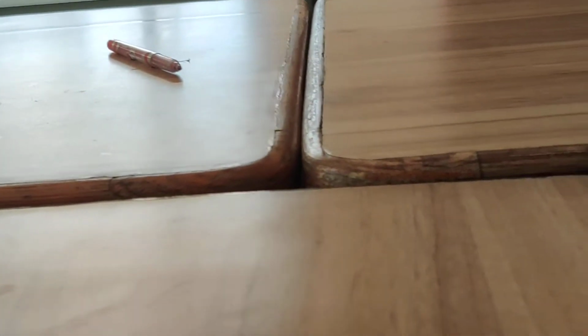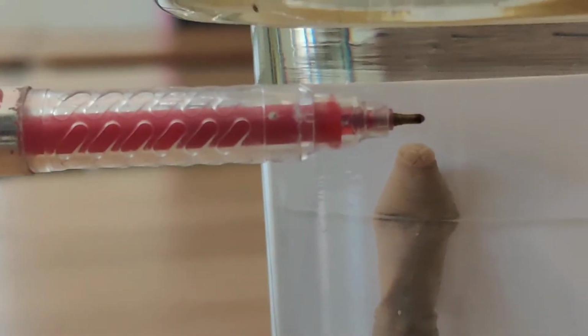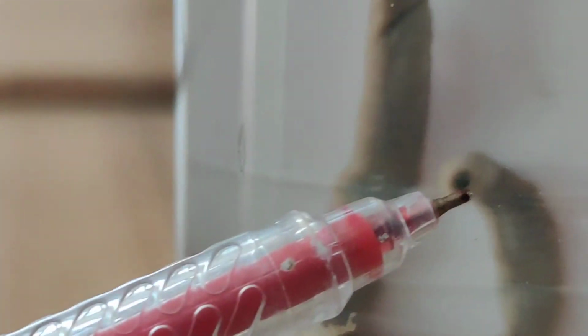Now another phylum is phylum Annelida, and in phylum Annelida, I have two specimens for you. This is earthworm, Pheretima posthuma. You can see its body is segmented, metamerically segmented. It has this region, clitellum. This is its anterior side, mouth. This is clitellum, and on the lower side you can see this opening. This is anus. Throughout the body it is metamerically segmented.